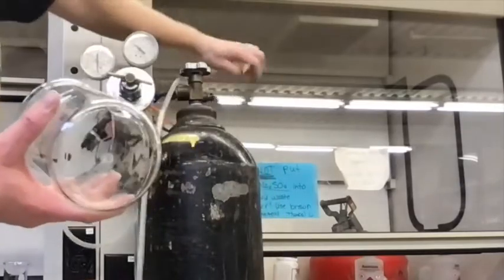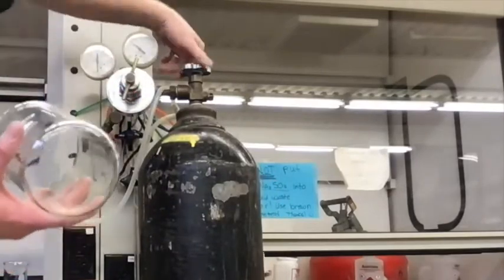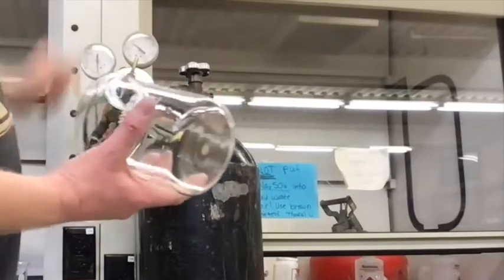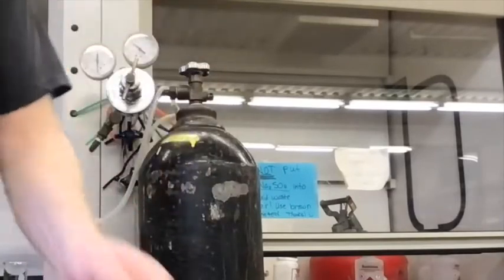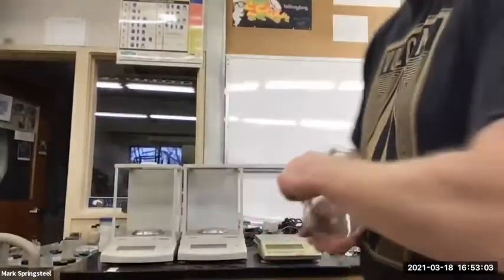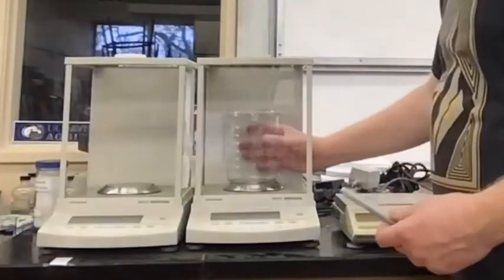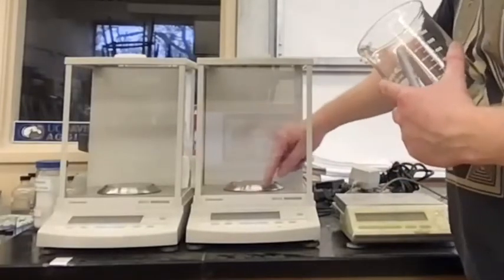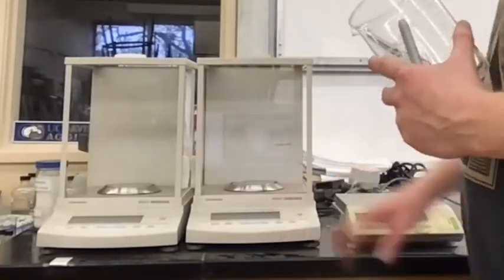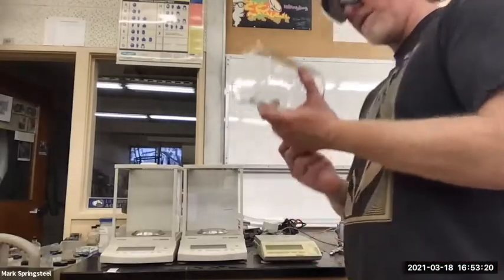And now, after I've done that, I'll make sure this is off. So I read 0, and then I close the top always, just in case this wants to leak. It's closed here as well. Okay. Then I'm going to go over and get the mass of this. So this is a big beaker. I don't think it's appropriate to weigh it in here. It's going to hit the sides of the scale. I could lift that out, but I think this is still not really made for such a heavy object. So I'm going to weigh it on this top loading balance. This one's made for heavier things.